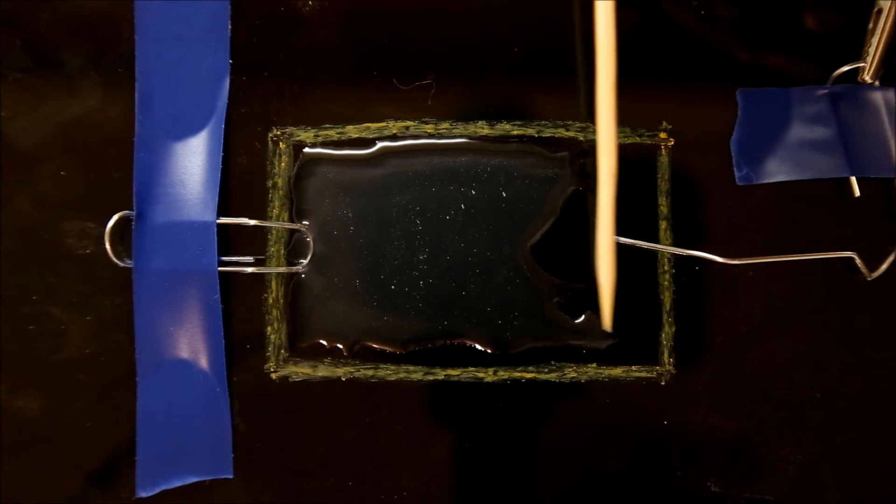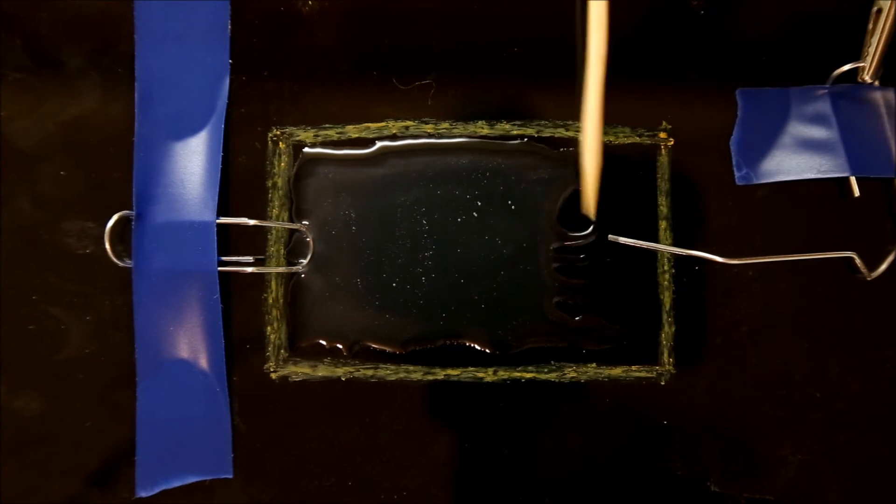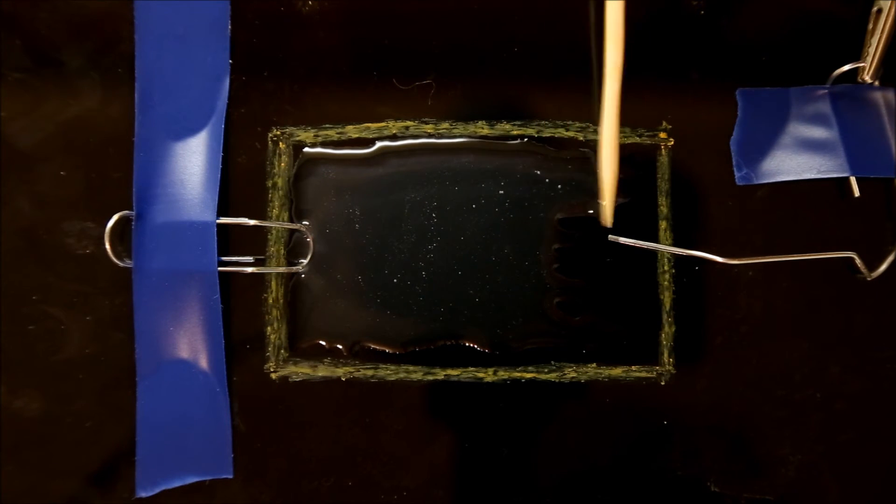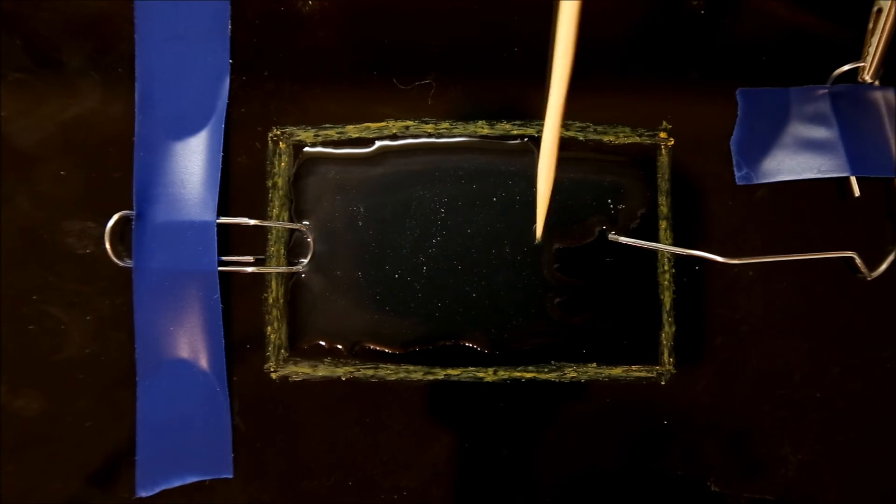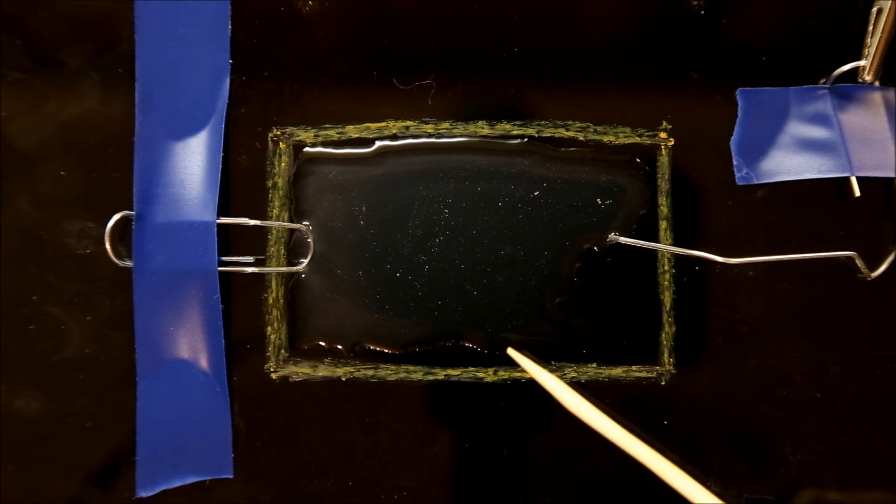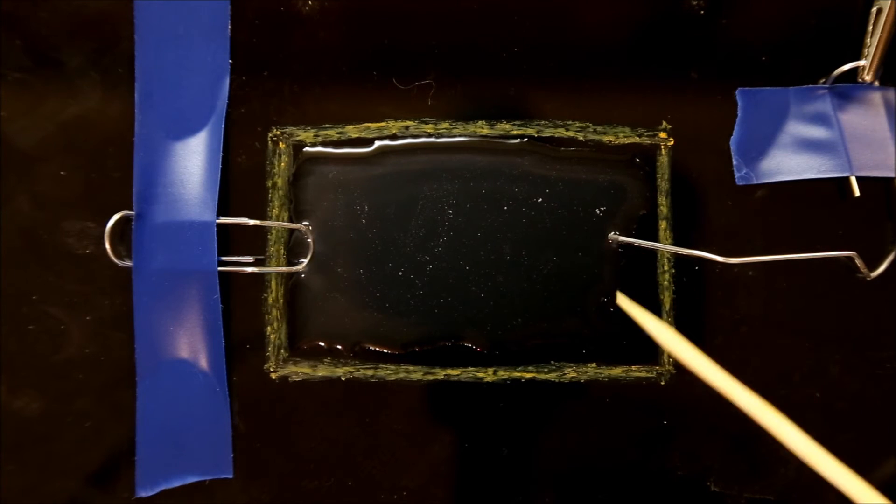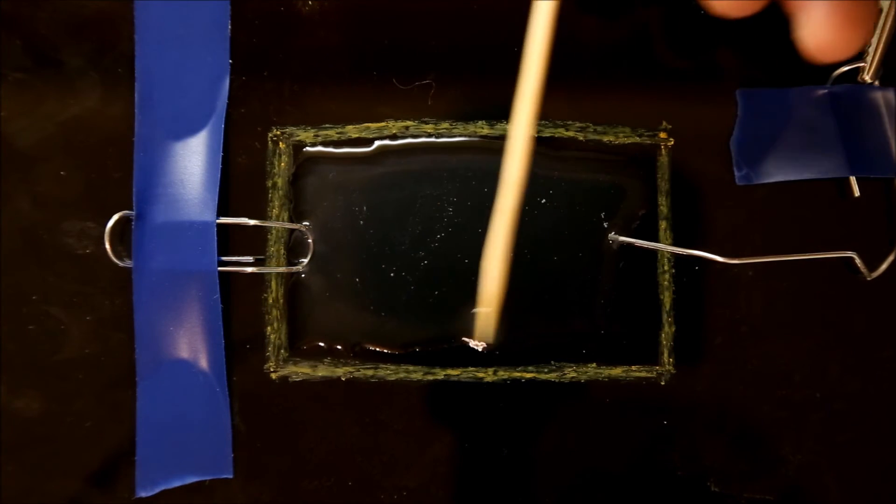On the other hand, if you use much less, say just two grams, the growing solution is so thin that even at 12 volts, there's not enough voltage to push the current through it. So three grams of solution seems to work about the best.